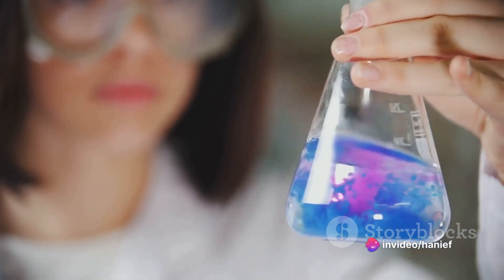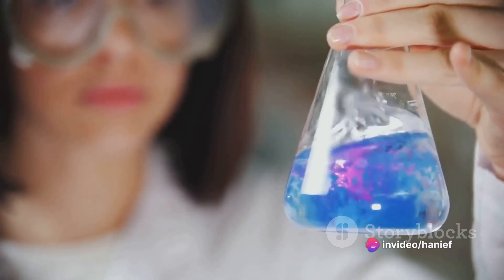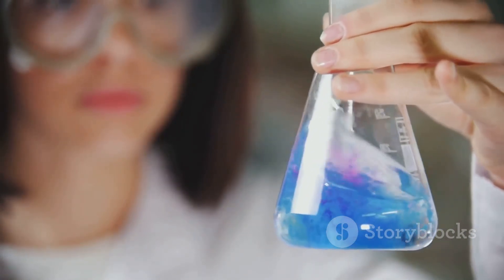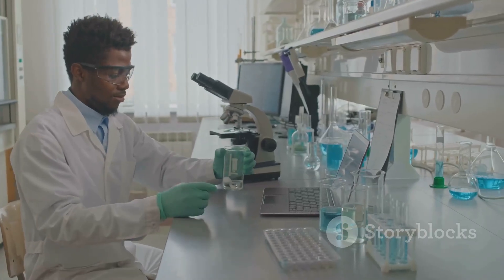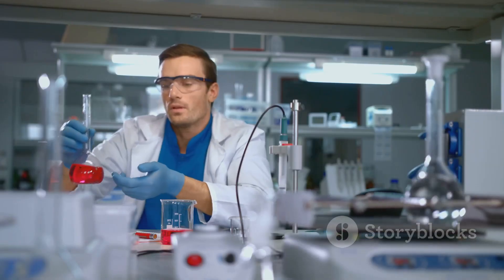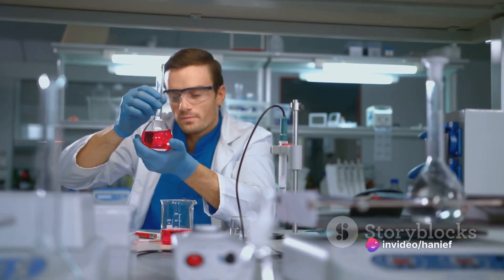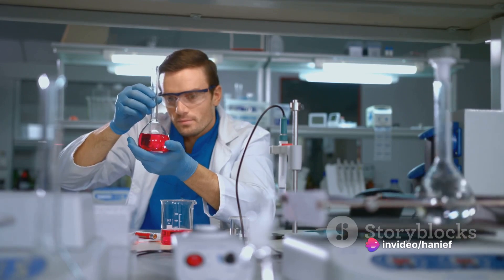The sudden change in color signifies the end of the titration process. Note down the volume of sodium hydroxide used from the burette. With this value and the known concentration of sodium hydroxide, you can calculate the concentration of the unknown hydrochloric acid solution.